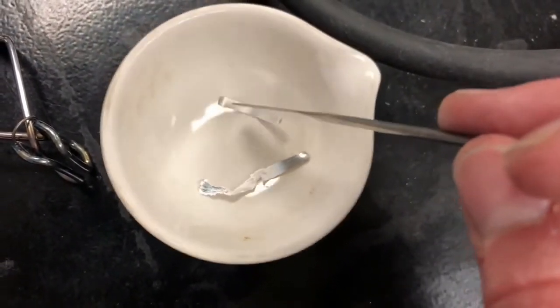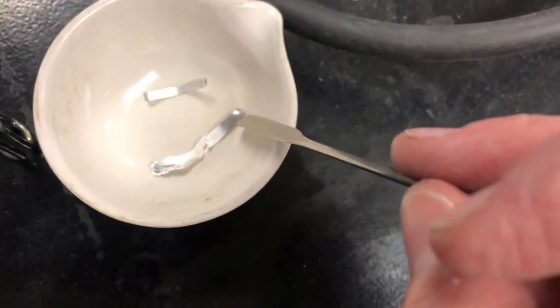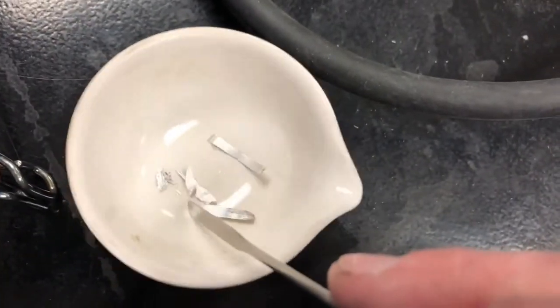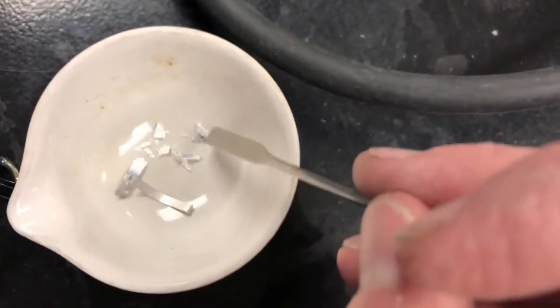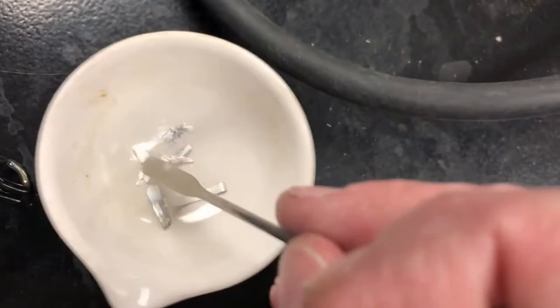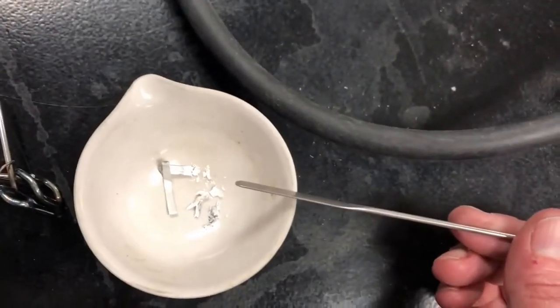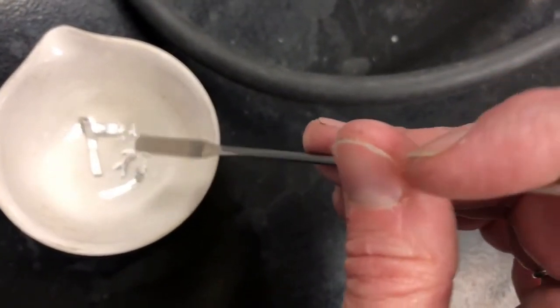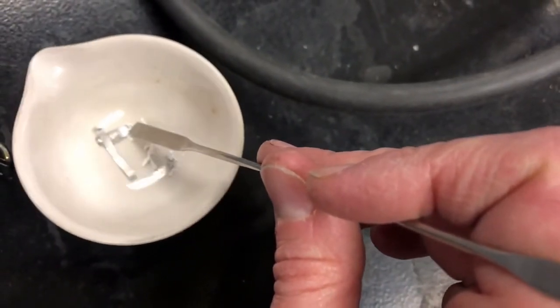So here I have an intact piece of magnesium metal, just for comparison. You can see it's solid. When I poke at it, nothing happens. And there's a bit of unburned magnesium here, but this burned magnesium, when I poke at it, crushes. It's very brittle, very fragile. It crushes into pieces very easily when I poke at it. You can see it's white in color. Mostly white in color. There is a little bit of soot here. That's soot from the flame, but the pure product over here is white in color.